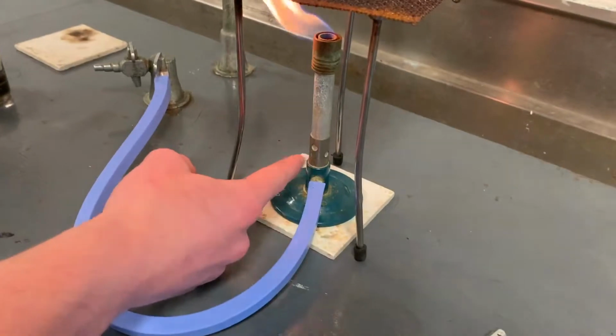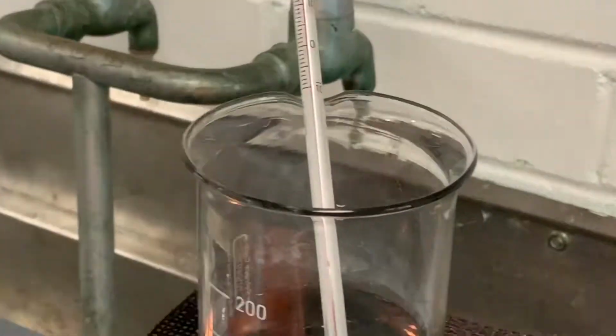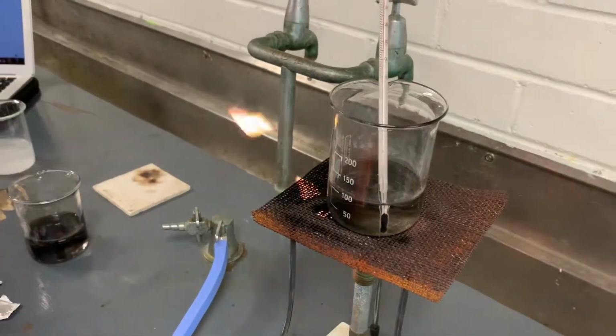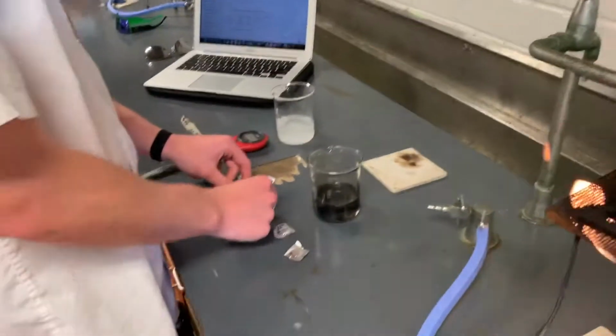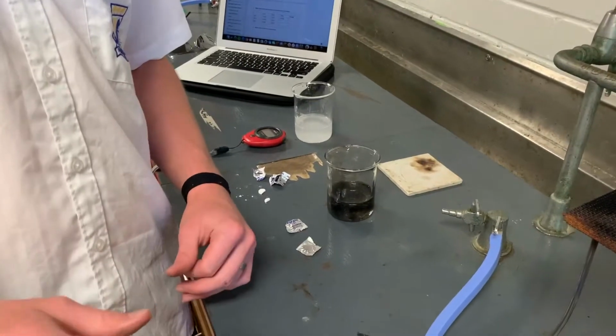Unfortunately, we do have a problem with the Bunsen burner. I am not able to switch to the heating flame, so looks like we are stuck heating up beakers with the safety flame, which is safer but does take longer to do so.